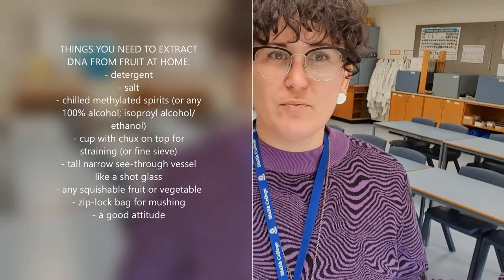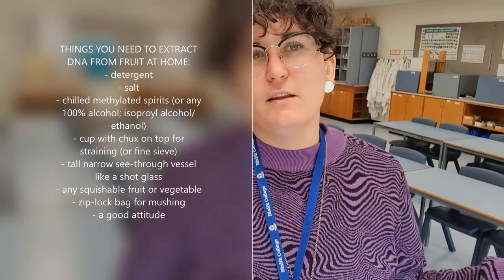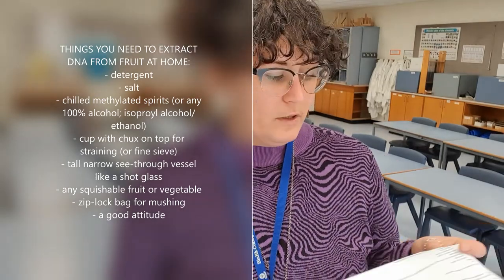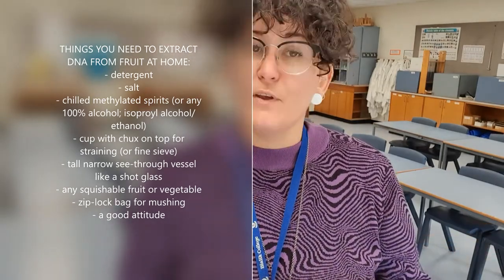Today I'm going to show you how to extract DNA from banana, and you can do this with any fruit. You can probably do it at home if you have soap, dish soap, salt, and you need like an alcohol, so methylated spirits you can buy from the supermarket. So if you want to give this a go at home you can.